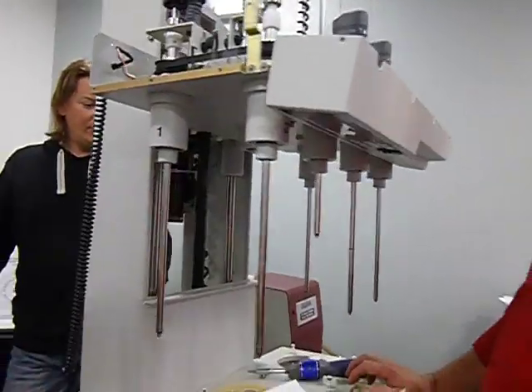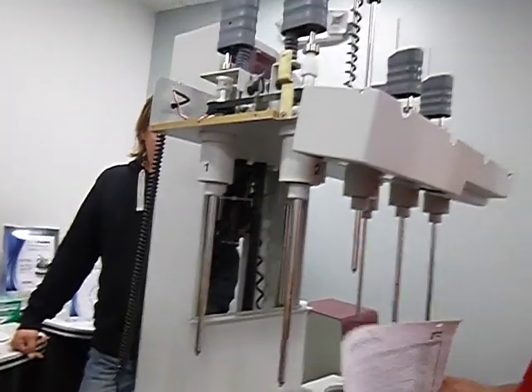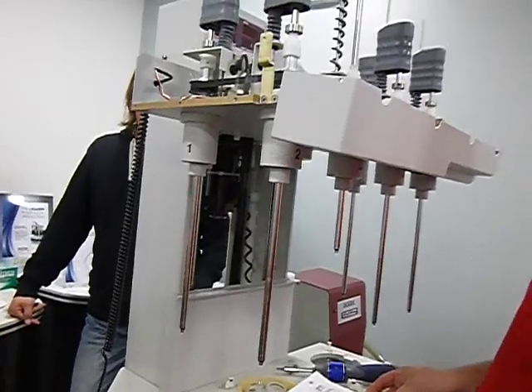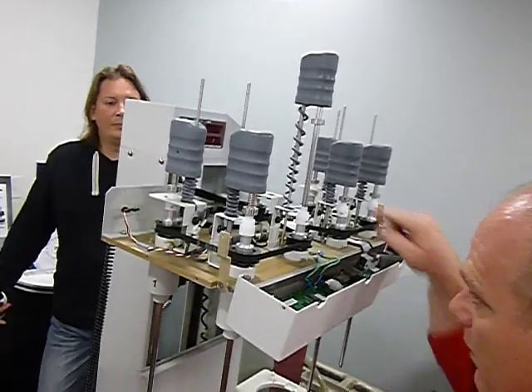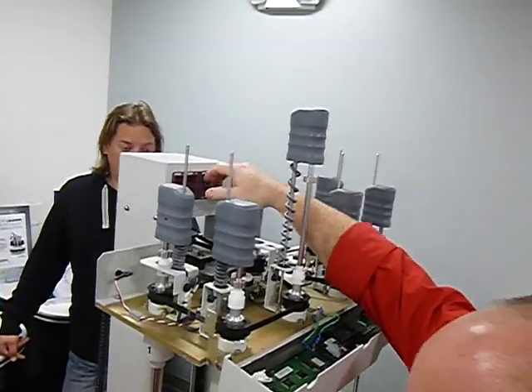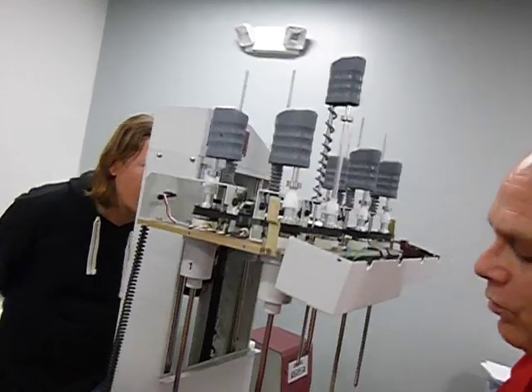We've had some inconsistencies with them. They've made some modifications to them. They've changed some of the firmware. Right now, we're experiencing some issues with it going up here. We've had some issues with the way it interacts with the board. But that's all we'll talk about tomorrow.